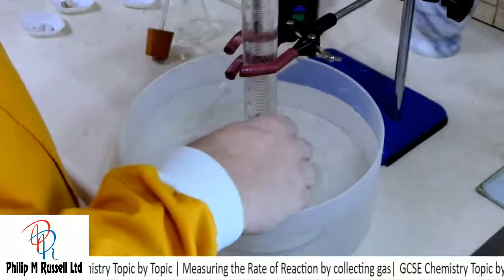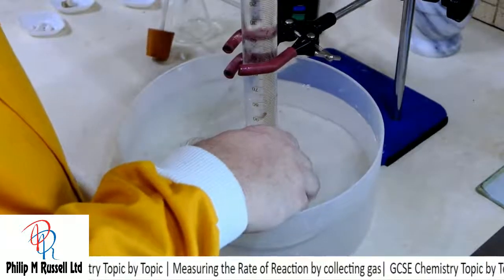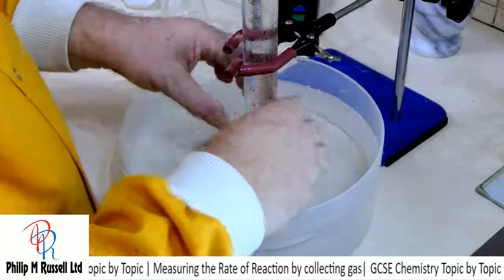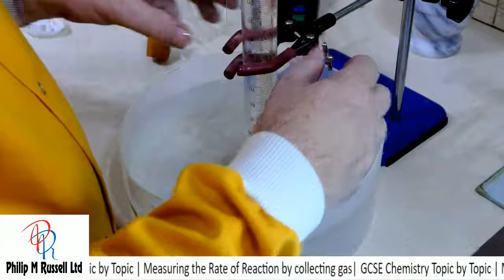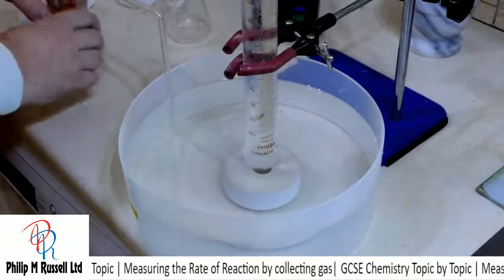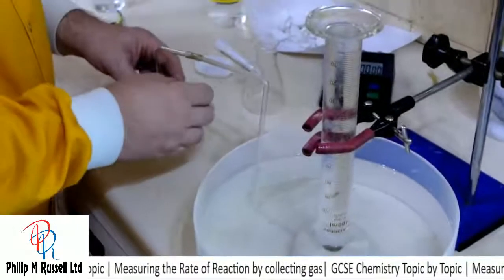I'm going to turn it round so that you can see. I managed to get a bit of air in there, that wasn't very helpful. That's all ready to go.